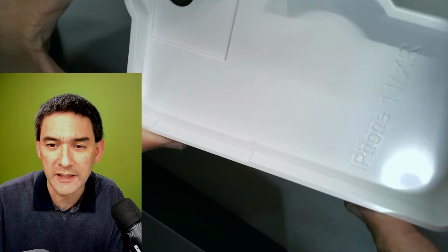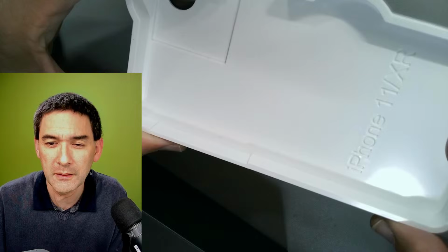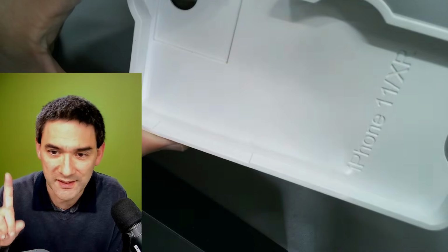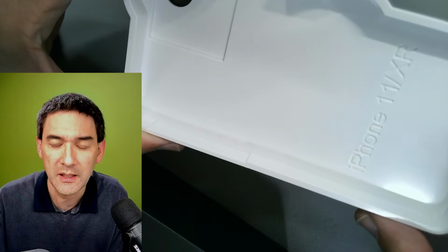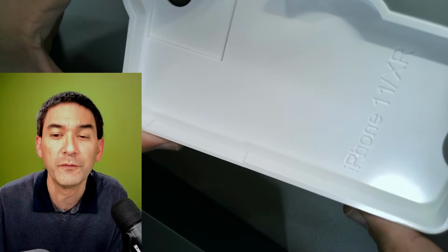Bioluminescent, yes, I tried a little bit, played around with bioluminescence. No, fluorescence, not bioluminescence. Okay, not bioluminescence, but I did experiment with fluorescence.